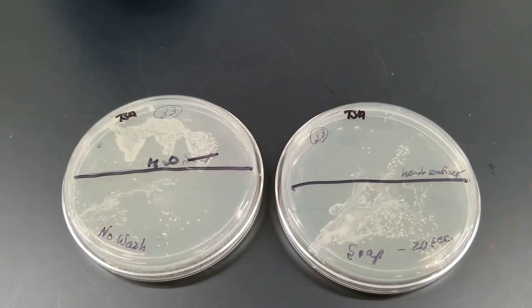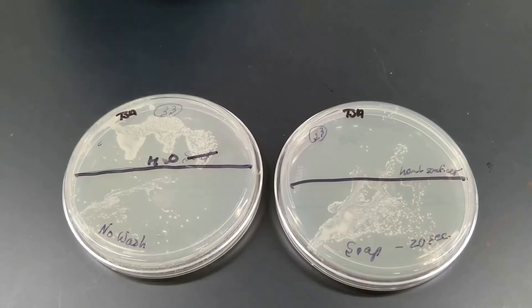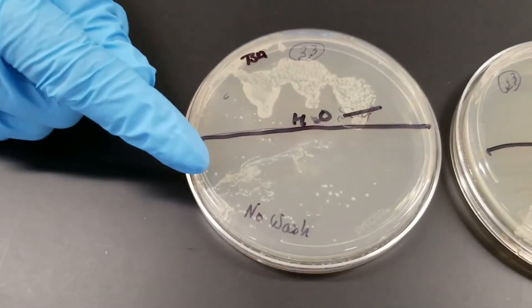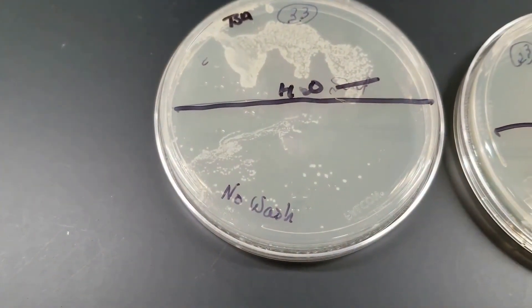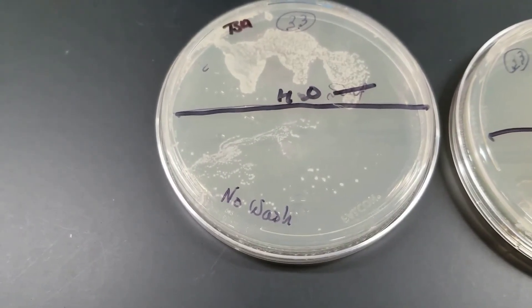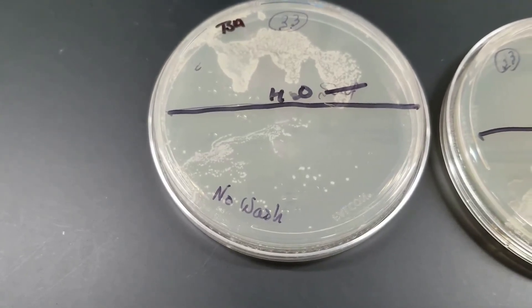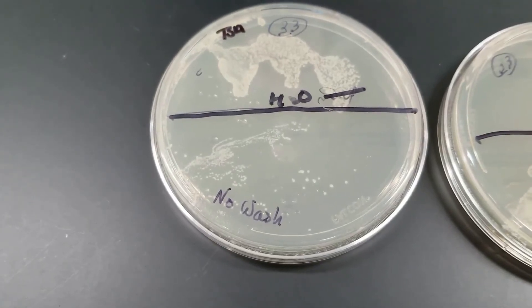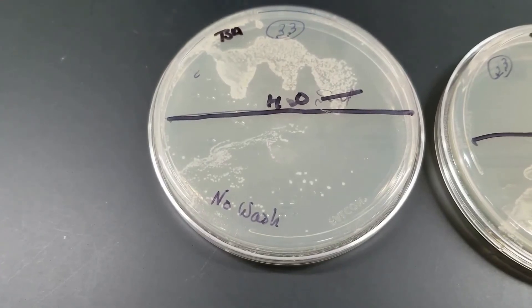We have four different spots on the plates that we inoculated. I used my three middle fingers to touch the plate. Starting over here on the bottom — that is where I just touched my fingertips without washing my hands at all. One thing I want to mention is that when I did this, I had been working in the lab all day but had gloves on. So touching things around my environment, I had not had direct contact, which could explain why the numbers are kind of low there.